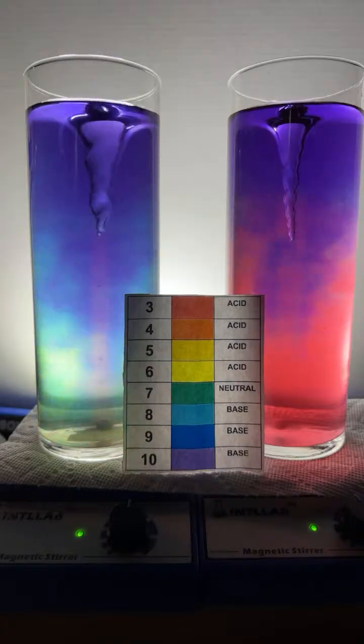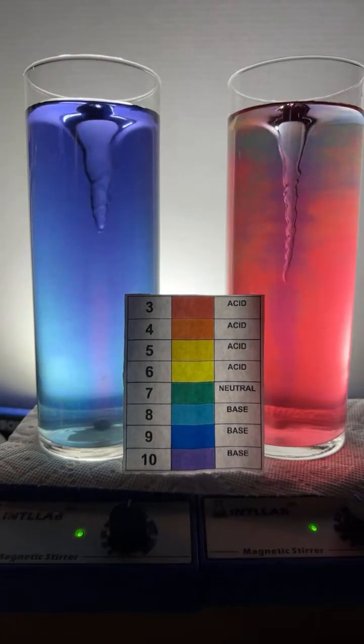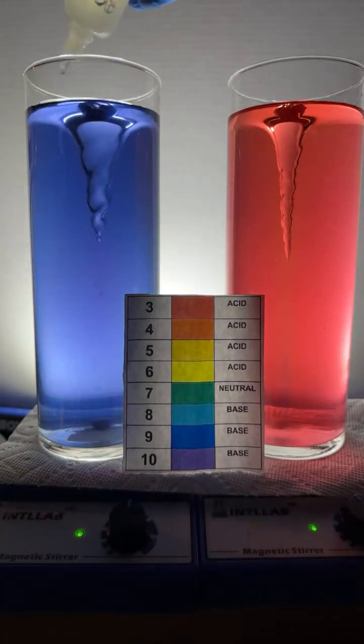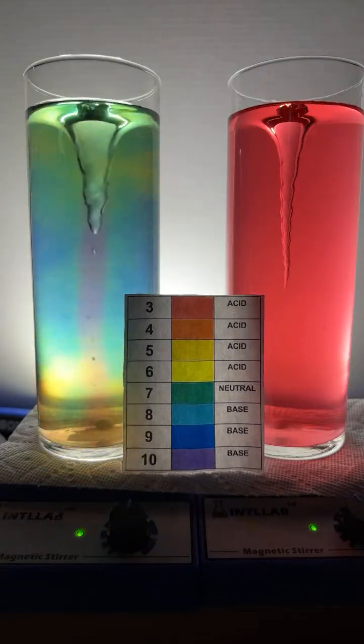I love the color transitions. How do the colors switch? Ask Chi-Chi, how do you do that? So let's talk a little bit about how this is done, all right? How this is done is I just take some water, and to that water, let's just show you from straight up.